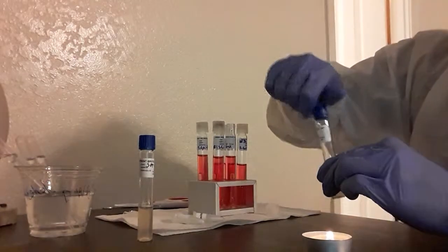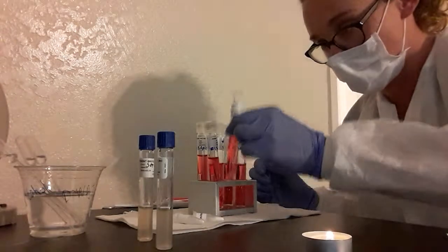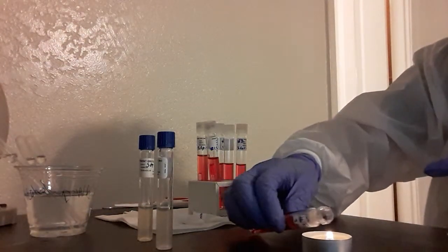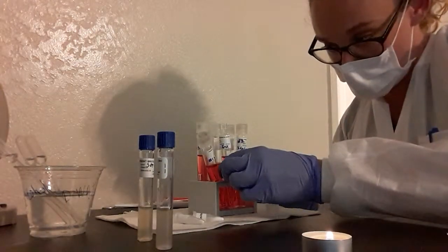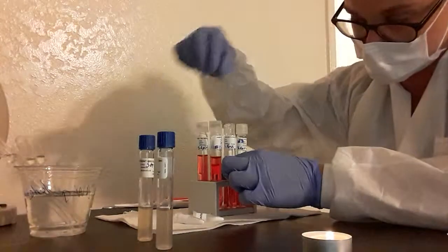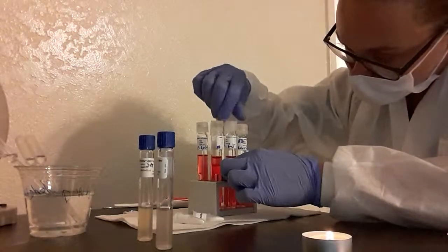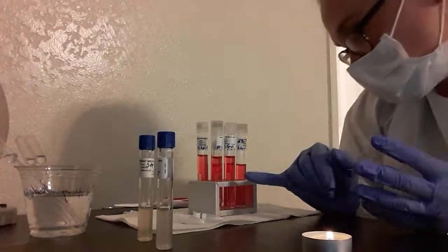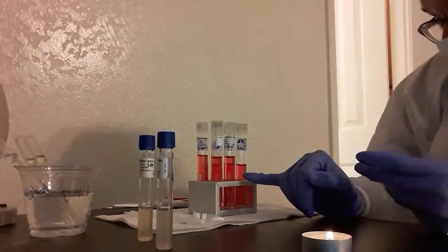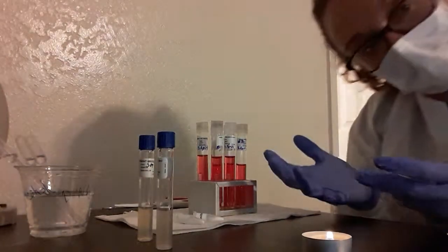Put the lid back on. Put that out of the way. I'm going to re-sterilize my red broth and put it back on here as carefully as possible. Put my lid back on, and then I'm going to wait 12 hours, maybe 18 hours, to see the results. So a yellow is going to be an acid fermentation. A yellow with air in these tubes here is going to be an acid fermentation with a gas byproduct.